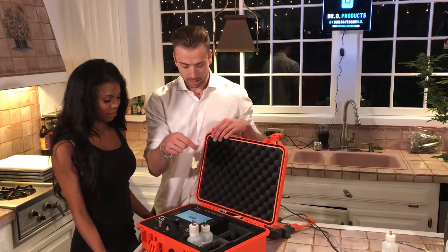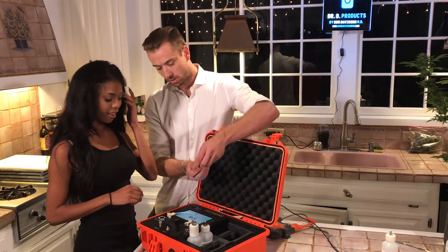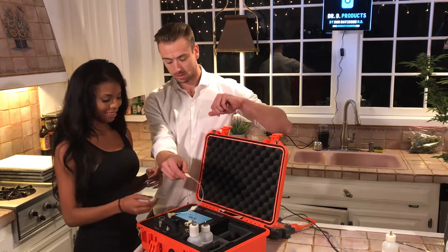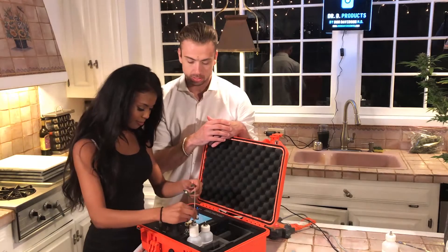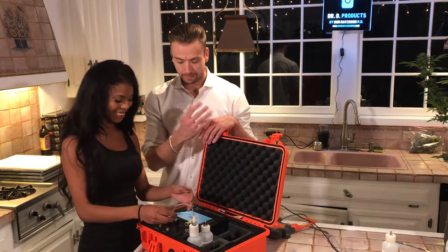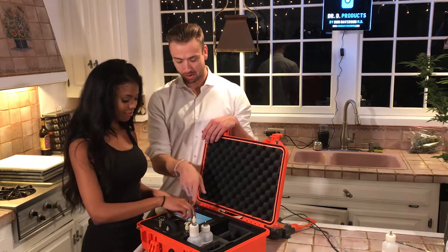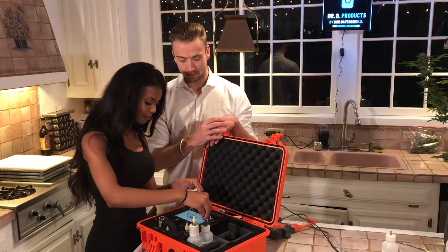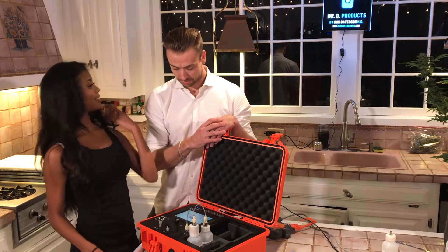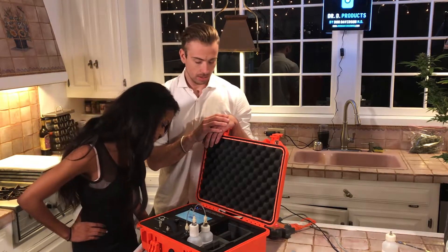So these lines are going to connect our bottles. This is pretty neat — this would be the male end into the female receptacle. Go ahead and do that — I want you to show people how easy it is, even with fingernails. Now take these and go ahead and put these female ends under these male ends. And what is the last step we have not done yet that's in that message? Make sure the column is in place.